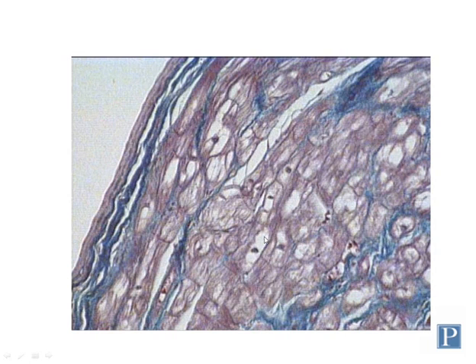That's because they don't have contractile myofilaments on the inside of their cytoplasm, so their cytoplasm appears to be pale or kind of empty. These Purkinje fibers play a role in fast conduction of electrical impulses through the myocardium, and so they're specialized non-contractile cells. That's why they appear different. These Purkinje fibers you find close to the inner surface of the heart, so if you want to identify the endocardium, you should look for these Purkinje fibers.